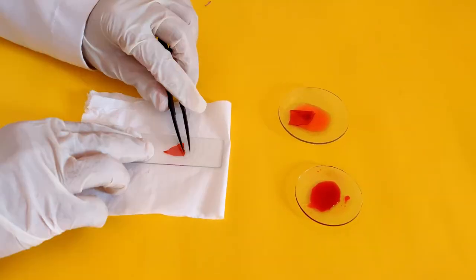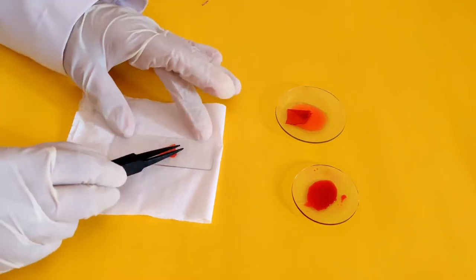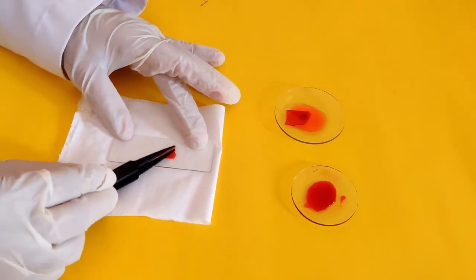With the help of the tweezers, push out any air trapped under the sticker through the sides.